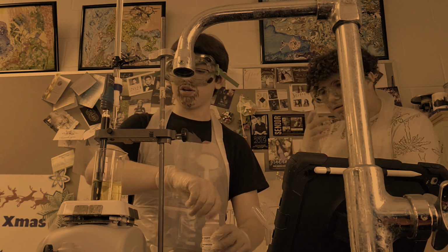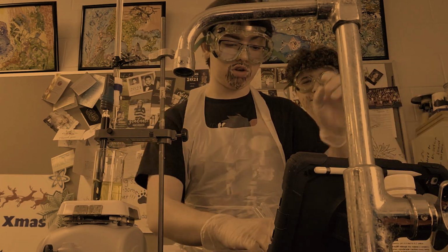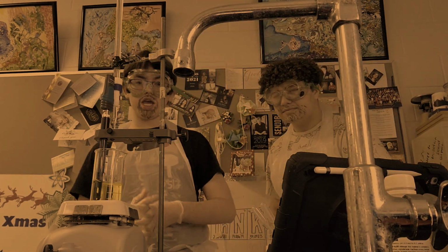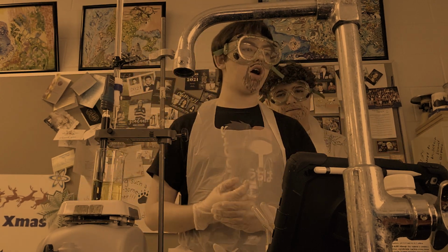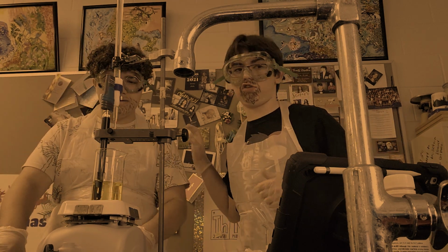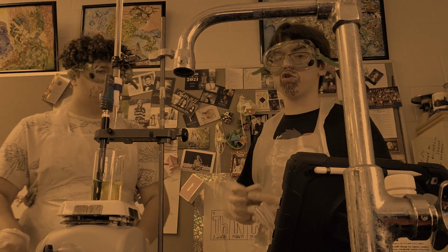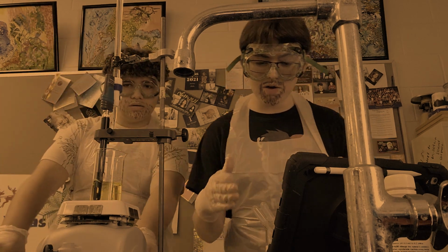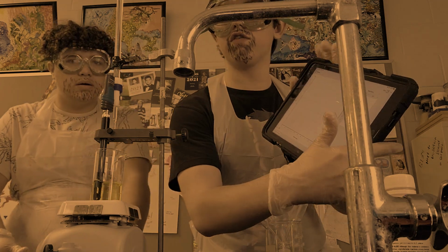Now that we've gotten our pH indicator solution inside of this, we are able to find out what this will be. So now, what are we forecasting? What we've calculated, Jessie, is that our initial pH is going to be 11.33, and if we take a look here, it's 11.33 on this device we have.